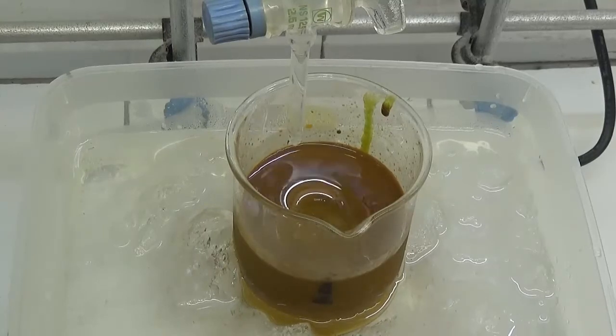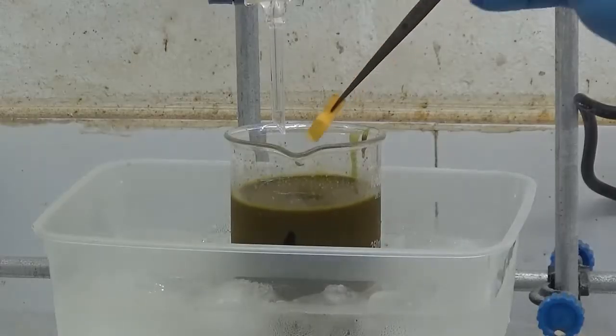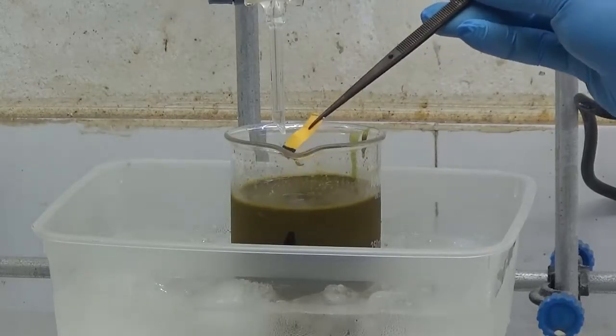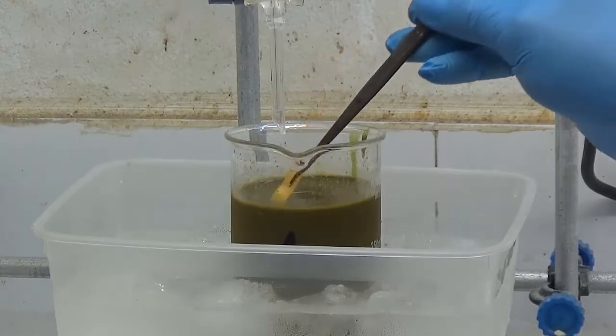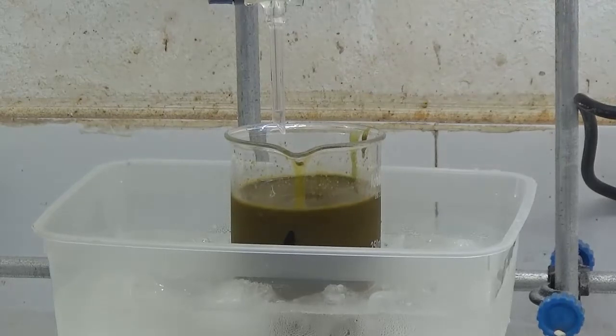Orange brown precipitate is formed. Use pH paper for verification. 40 ml of sodium hydroxide solution have been added.